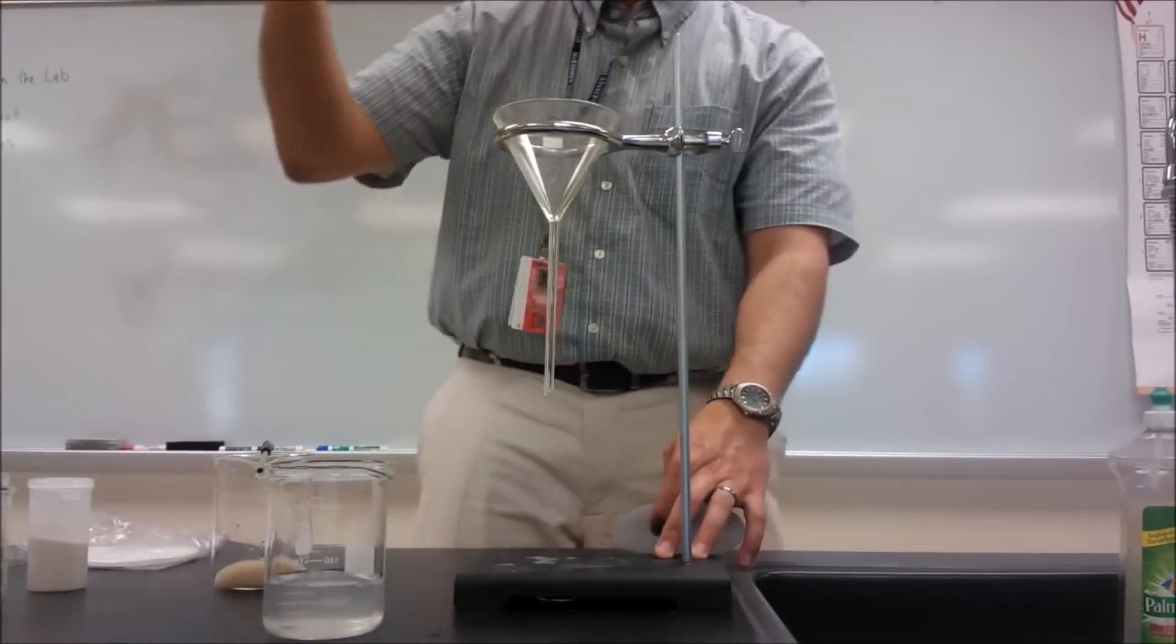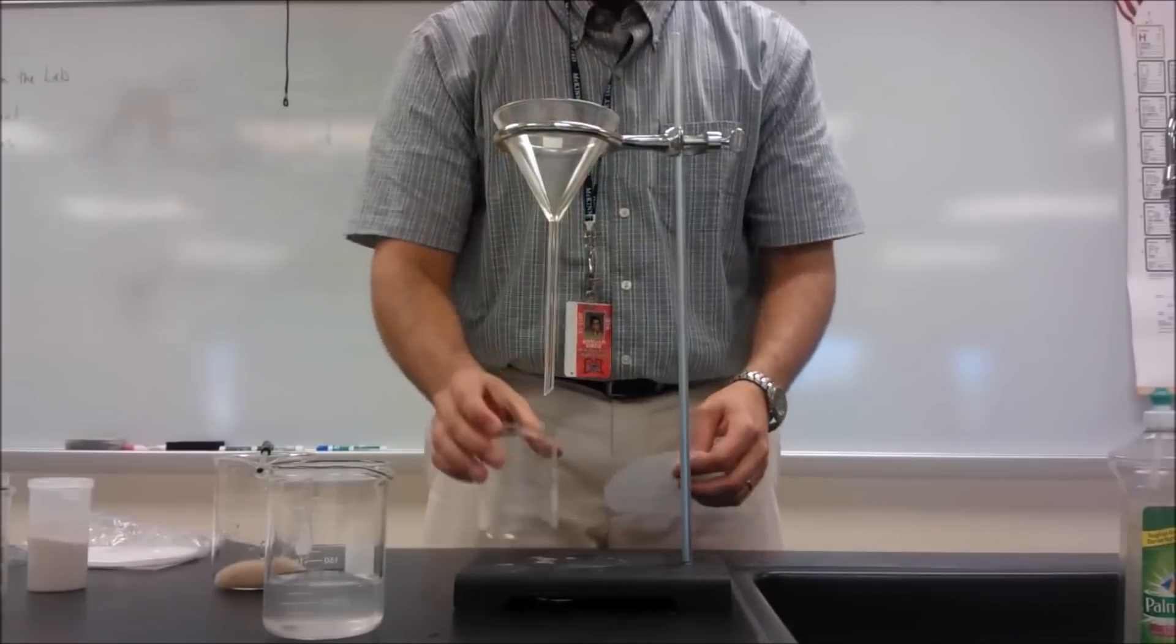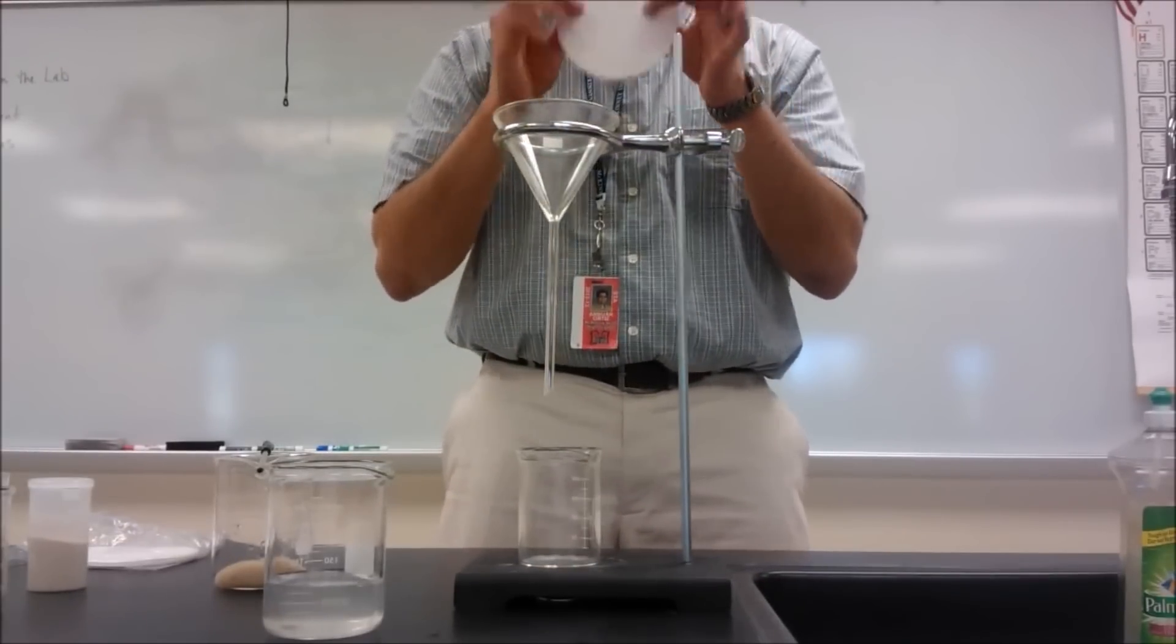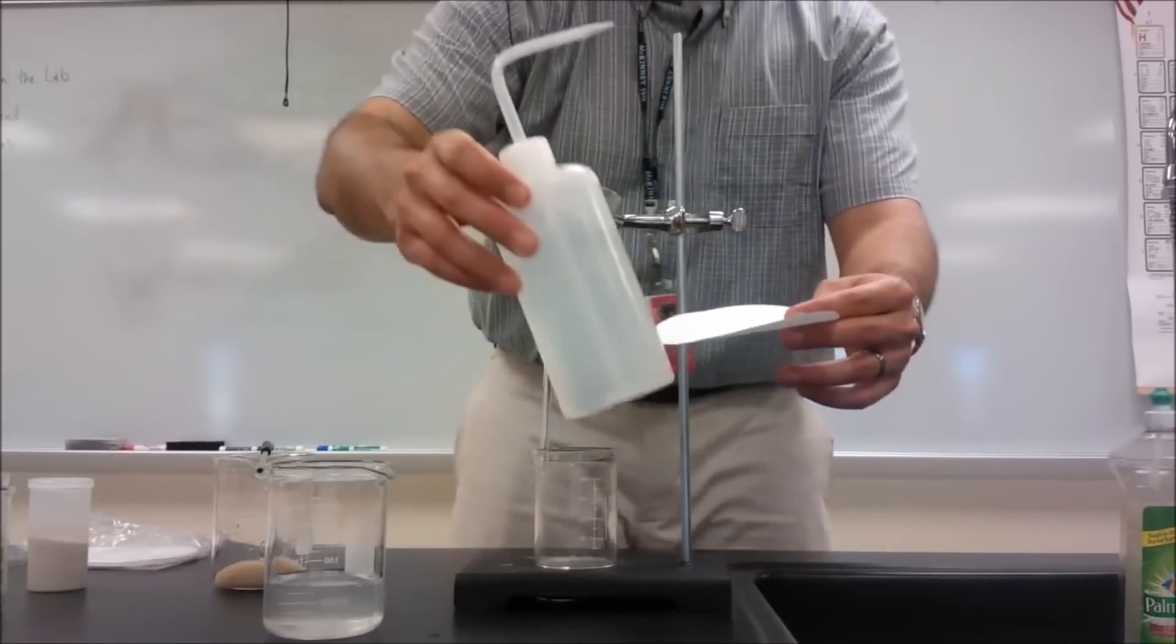I have a beaker that I'm going to hold my liquid in, and I've got a filter paper. I've got a filter paper. I'll show you how to use the filter paper. My wash bottle.